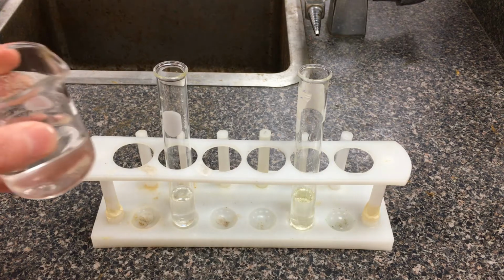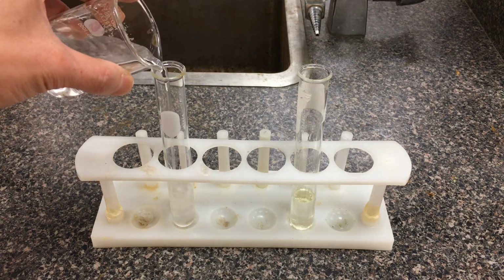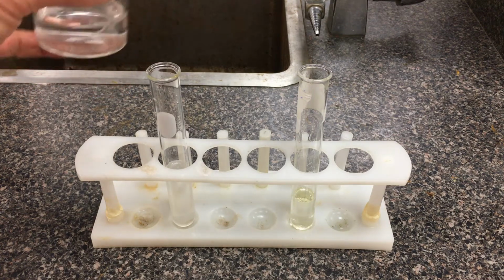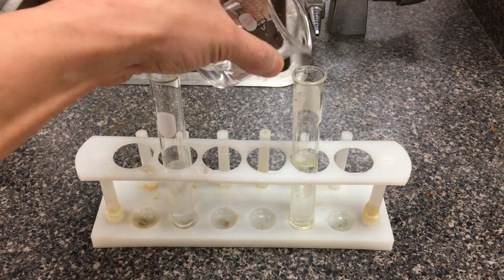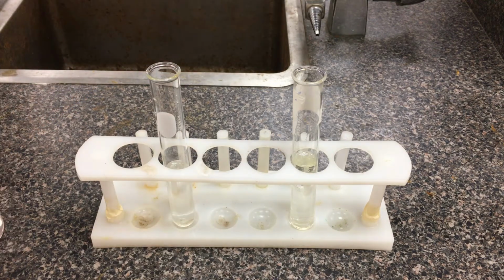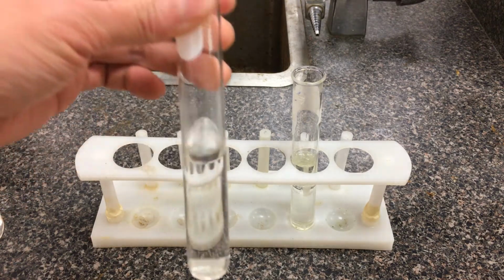So I'm just going to take some water in this beaker here and add it to the test tubes. Just make some observations. Okay. So there's water and acetone there, and then water and oil. Again, we'll just let the solution settle a little bit here, and then make some qualitative comparison. You can even take a stir rod here just to make sure, if it dissolves, does it actually dissolve?